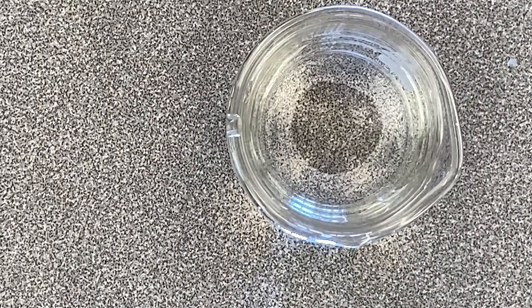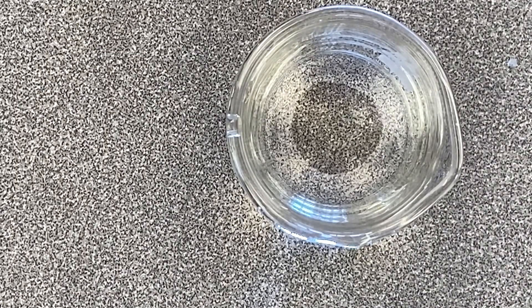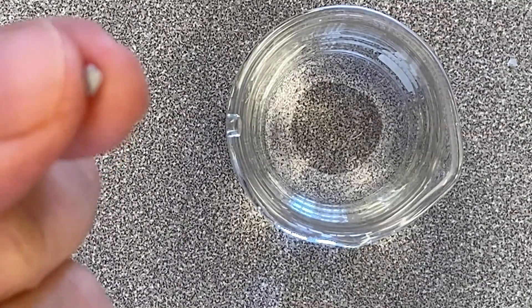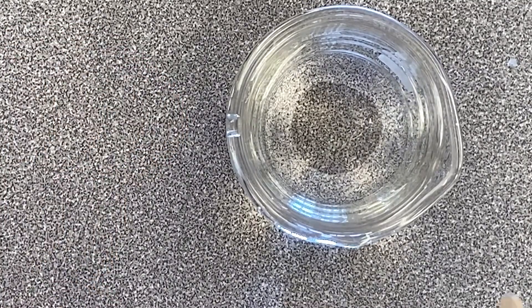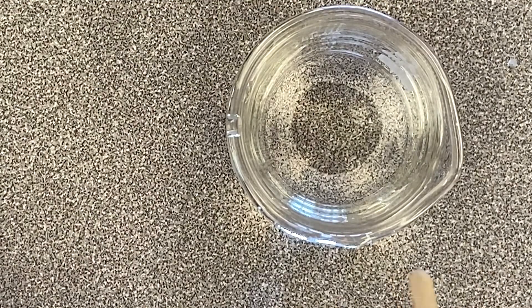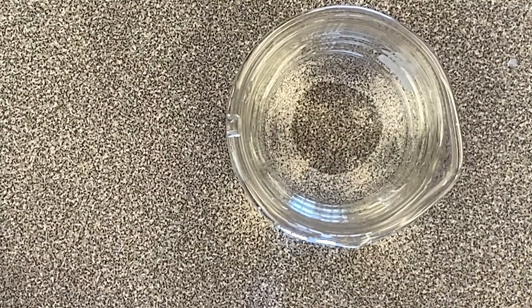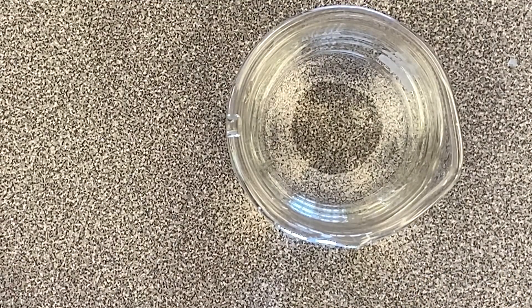I put some phenolphthalein into the water and it has not turned pink. If the water were a base in terms of pH, it would turn pink with the phenolphthalein. Once I put the sodium in, the sodium hydroxide will be a solution and it should turn pink.